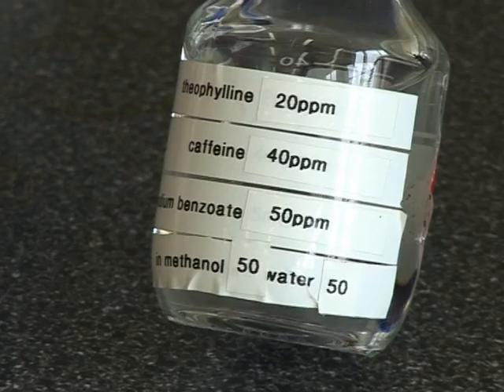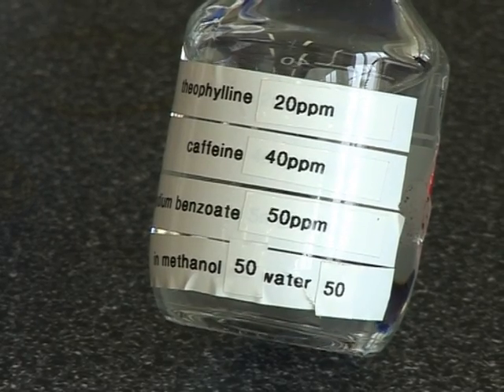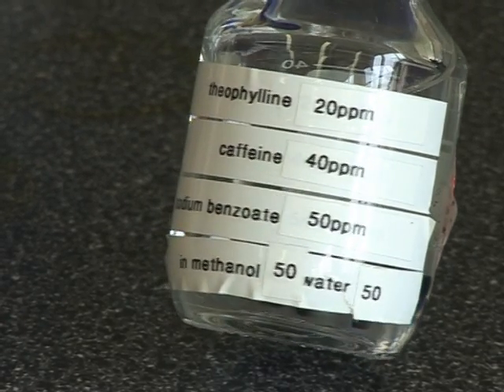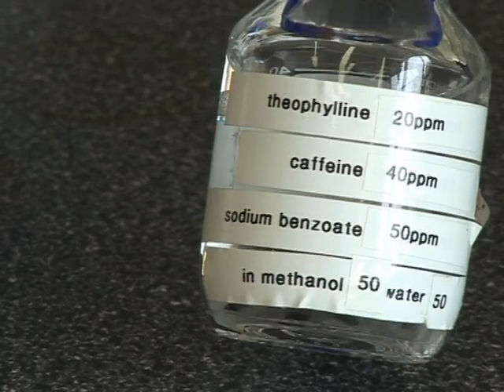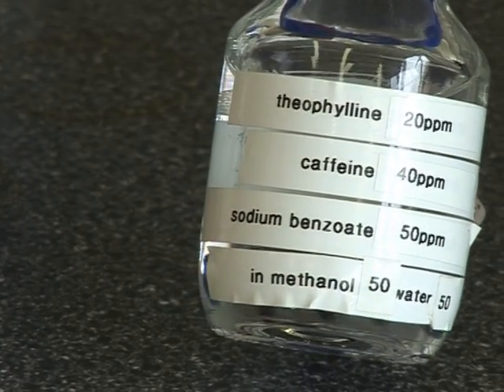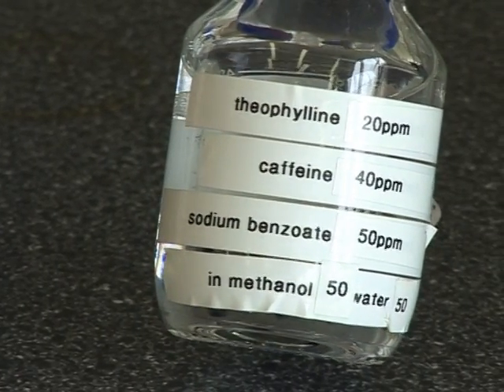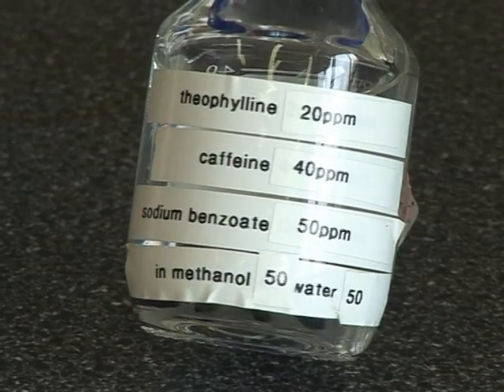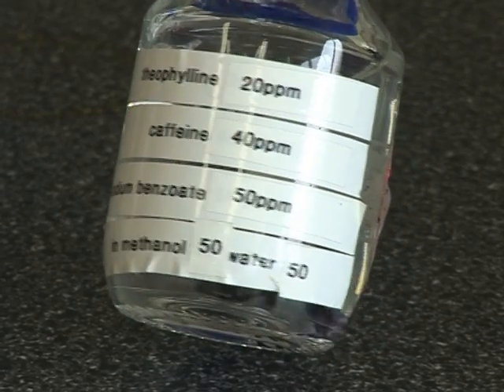You're also provided with a mixed standard containing 20 parts per million theophylline, 40 parts per million of caffeine, and 50 parts per million of benzoate. This mixed standard does not need to be diluted.